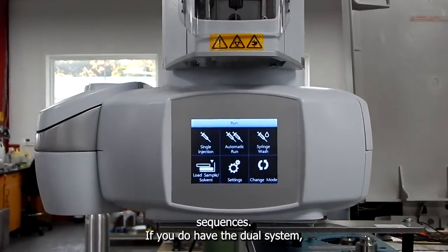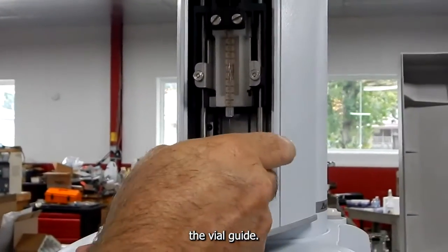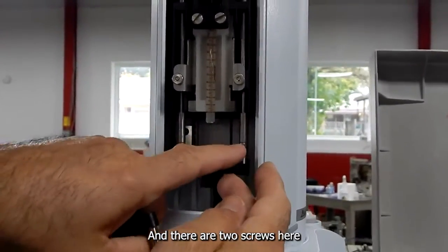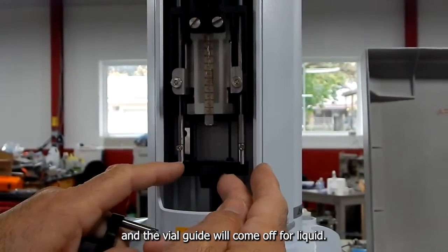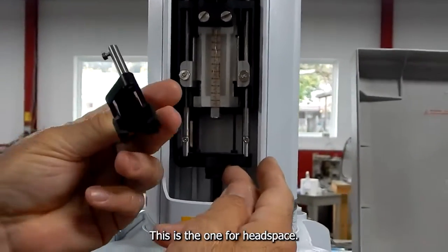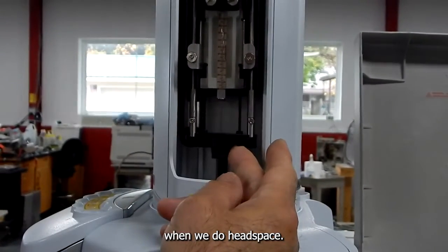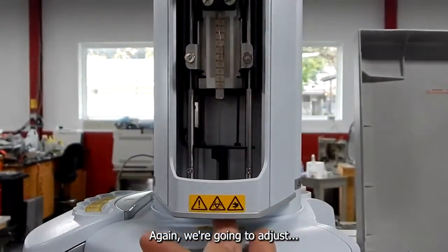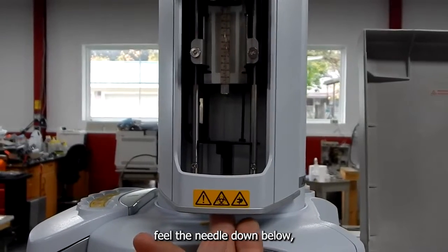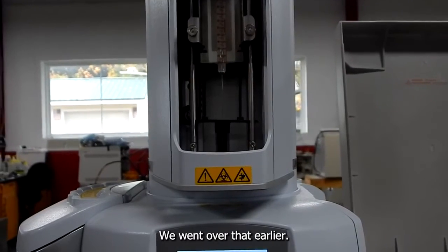If you do have the dual system, one thing you're going to have to change will be the vial guide. And there are 2 screws here, and the vial guide will come off for liquid. This is the one for headspace. It's a little bit bigger, so it can pick up vials, and that will be inserted on when we do headspace. Again, we're going to adjust, feel the needle down below, make sure it's just at the edge, not sticking out or too far in. We went over that earlier.